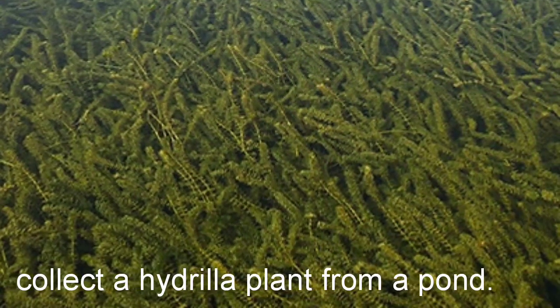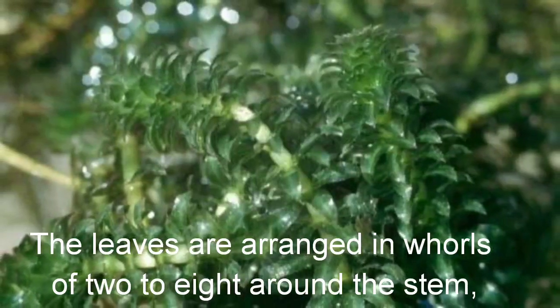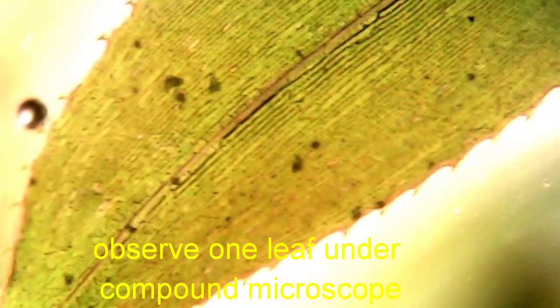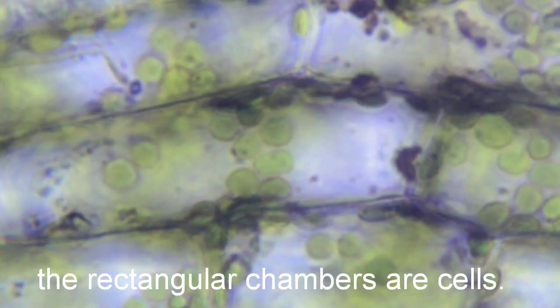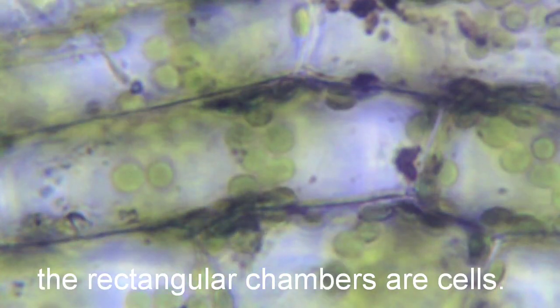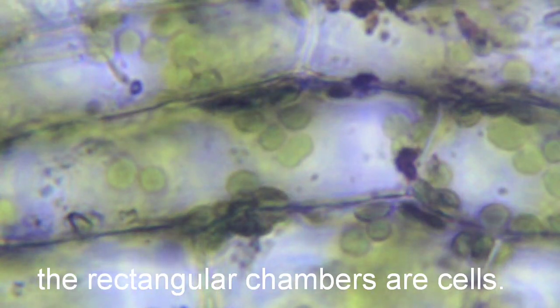Collect a hydrilla plant from a pond. The leaves are arranged in whorls around the stem. Observe one of the leaves under a compound microscope. The rectangular chambers are cells. You will observe small green granules in the cells called chloroplasts.